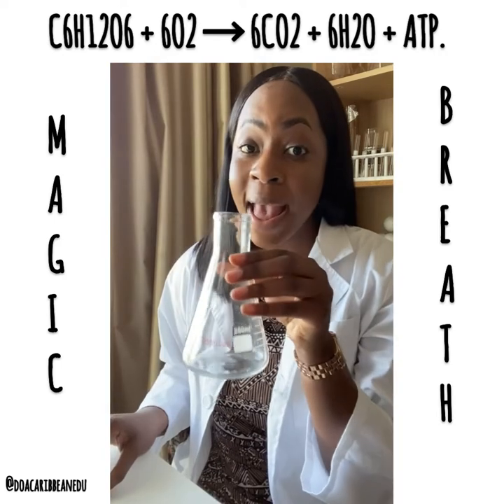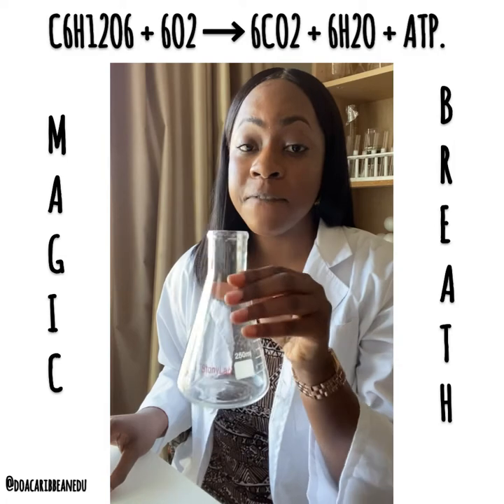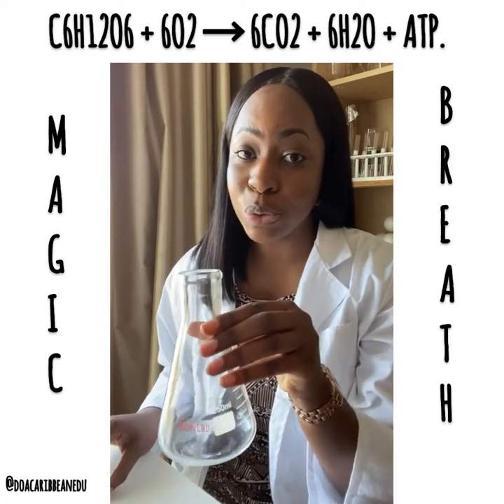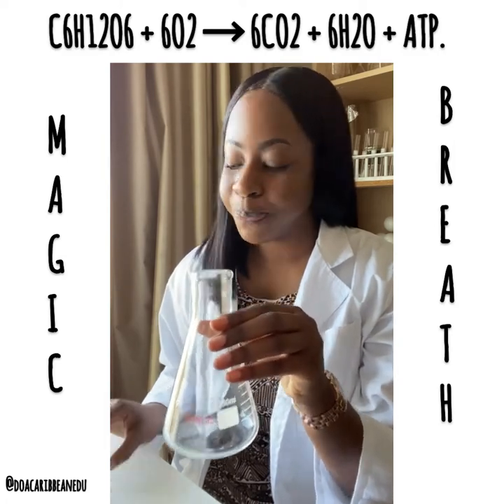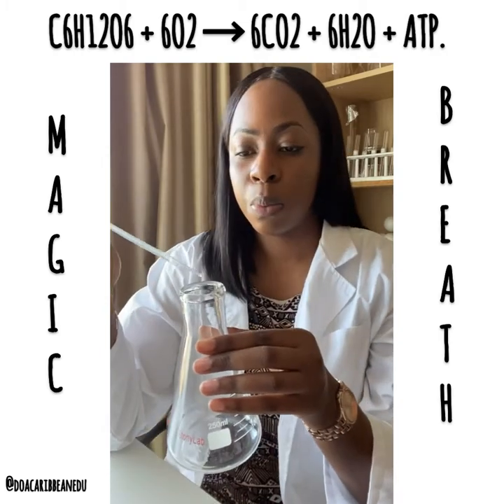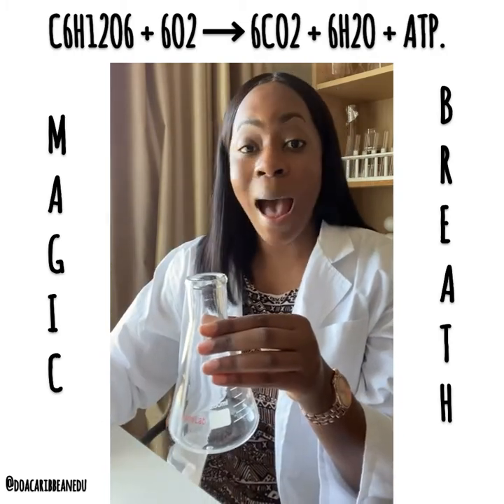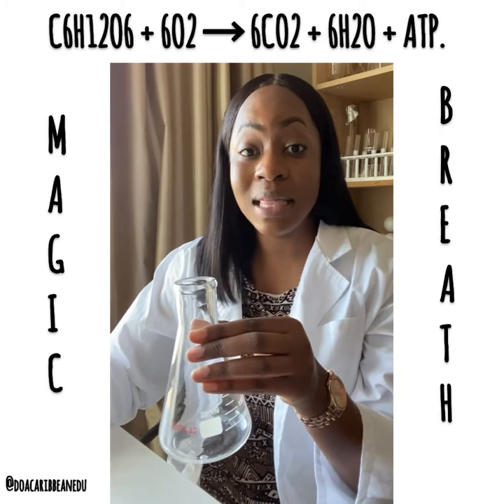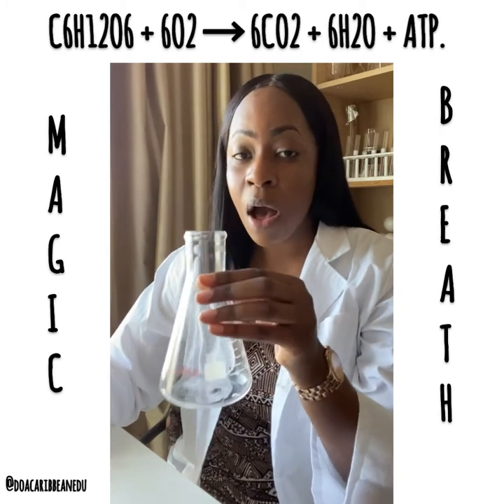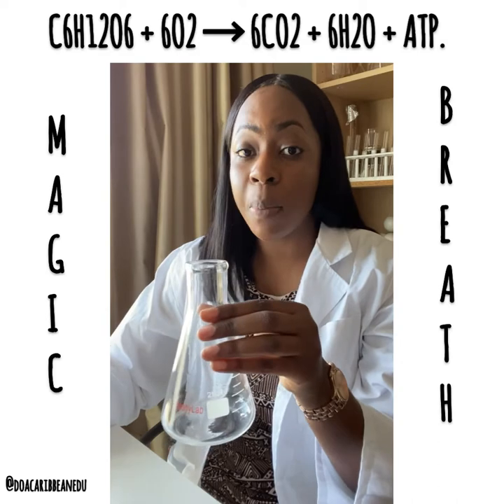Now to an empty conical flask, I'm going to add five drops of sodium carbonate solution. Next, we're going to add the phenolphthalein water solution to this conical flask with the sodium carbonate.